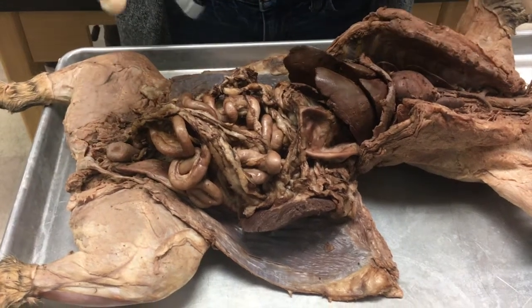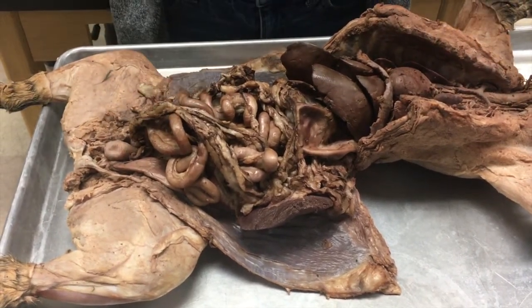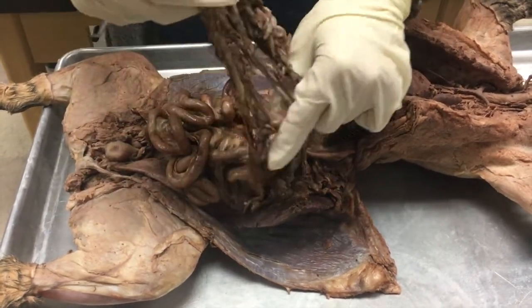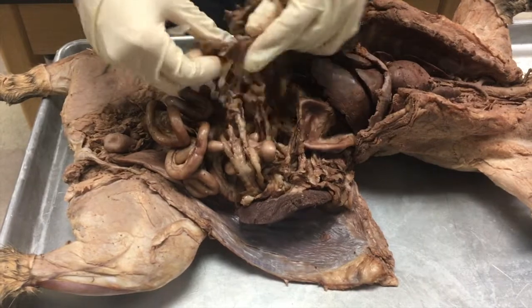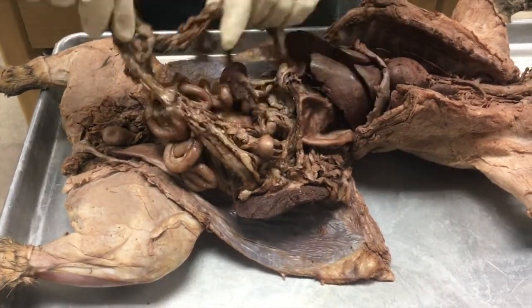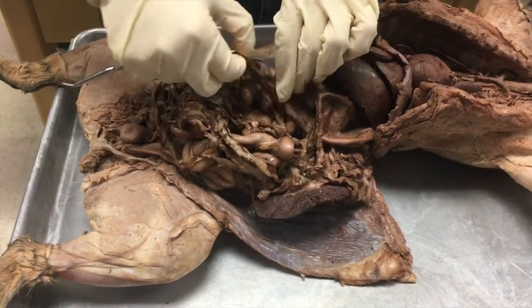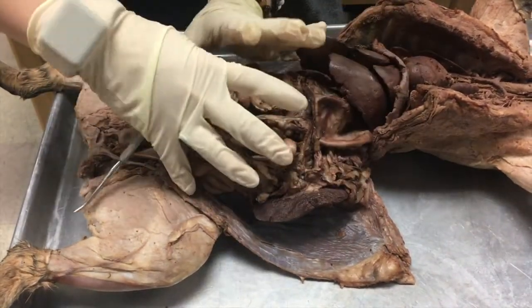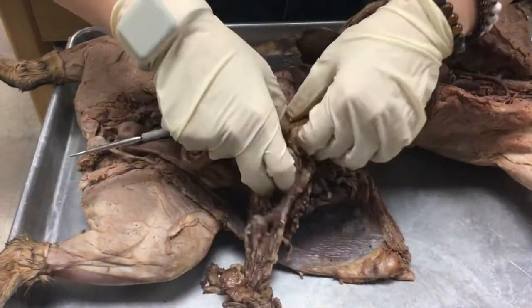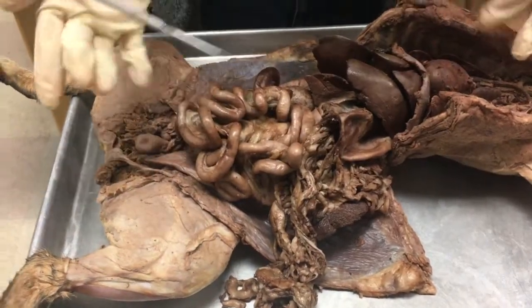We're going to go over the features of the superficial GI, starting with this material here called the greater omentum. It's a little bit torn, but it lays over the structures of the abdominal cavity and provides a covering to hold them all together. We'll move this out of the way so we can look at the structures underneath.